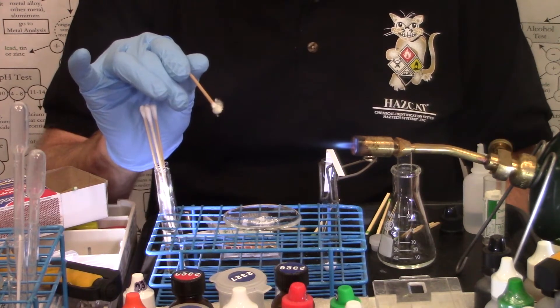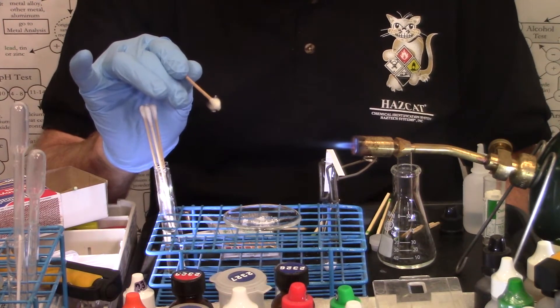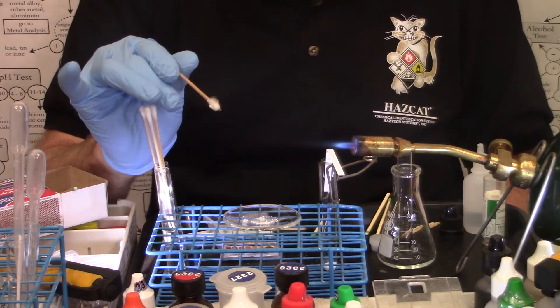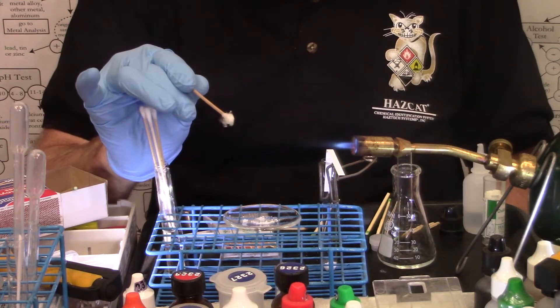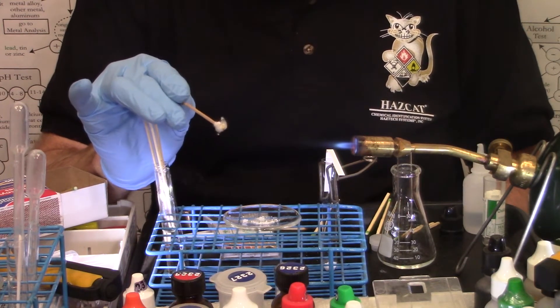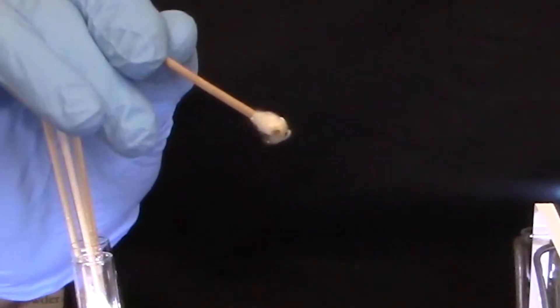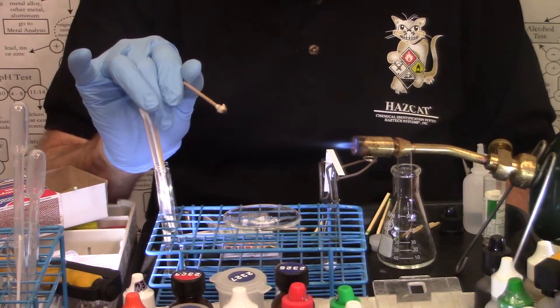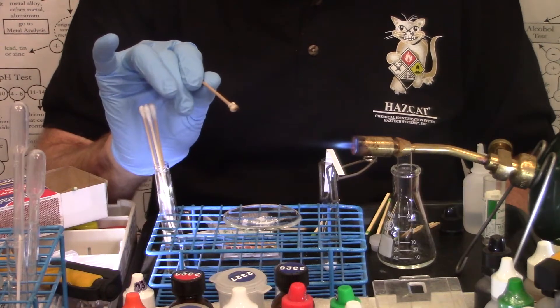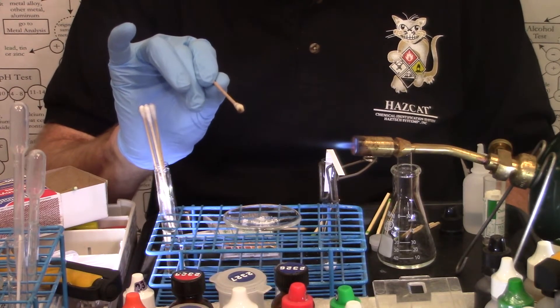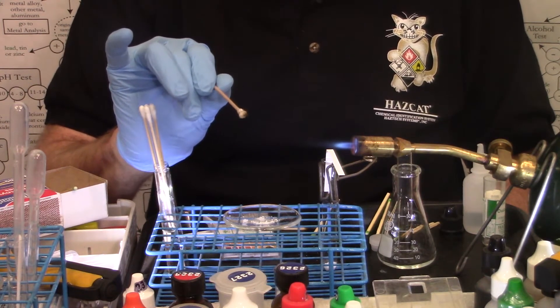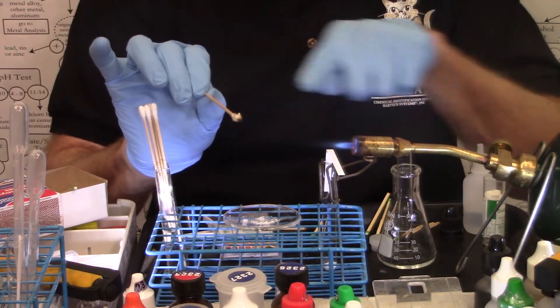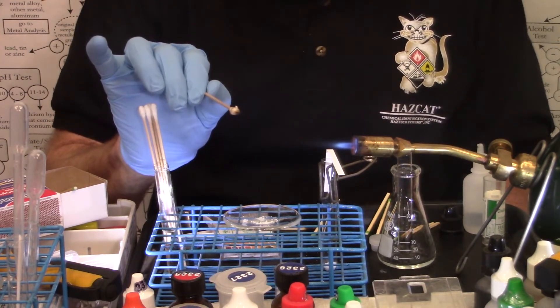And I'm looking for downward sideways bursts of flame, energetic white flashes. I'm listening for snap, crackles and pops. I'm looking for energetic behavior, indicative of an explosive. A little bit of sparking there, that seems a little energetic. That would be close. I would be a little concerned about that in regards to potential for an explosive. You don't want to get too close because the torch will blow the solid off of the swab.